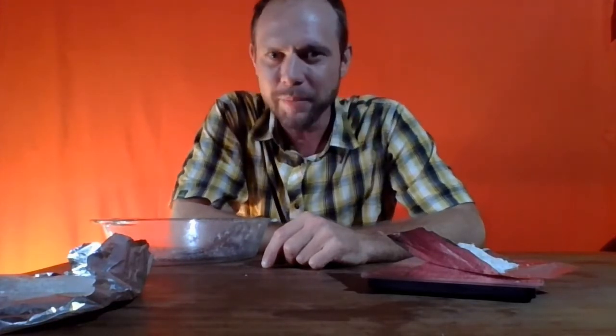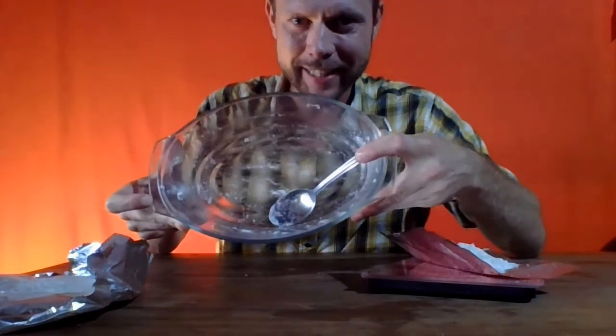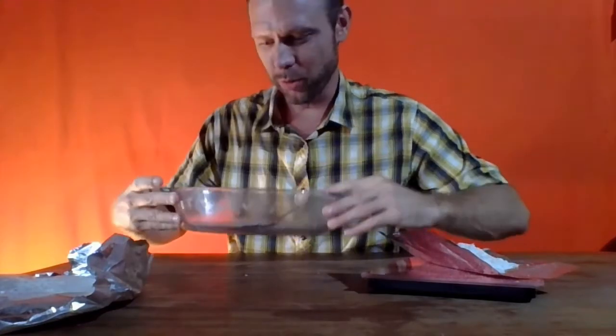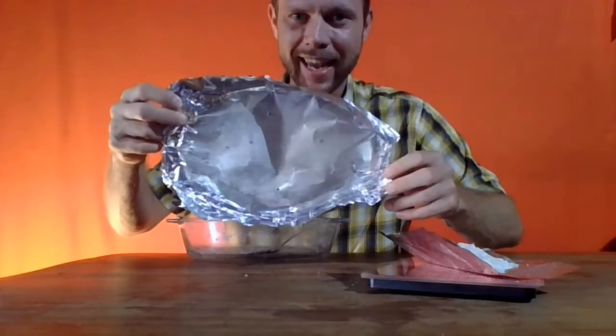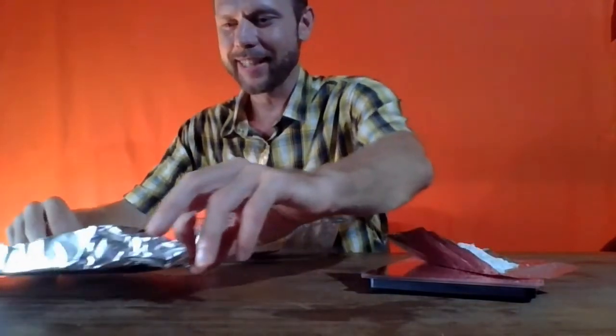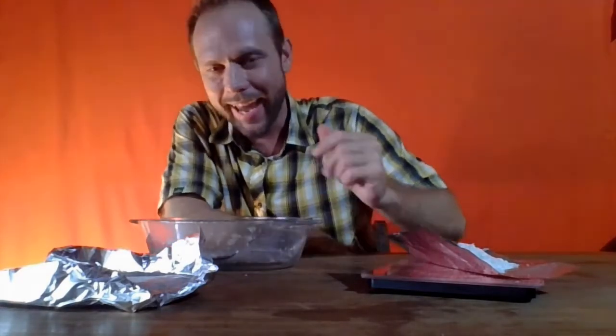So what's going on? Are we a gram short? Could the scale possibly be off by a gram? Now, as we look at the container, we can see maybe I didn't do exactly a perfect job of scraping it clean. And there's also a little bit of salt dusting the lid of the container as well that we had put in the oven. I could maybe continue to scrape here and try to get it. I'm not sure if I'd ever really be able to get it all.